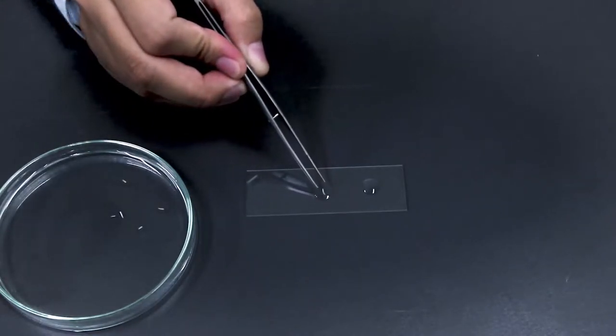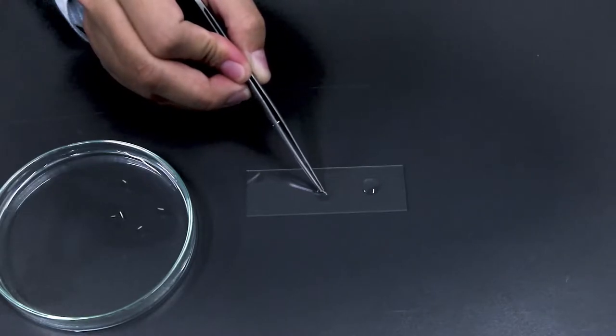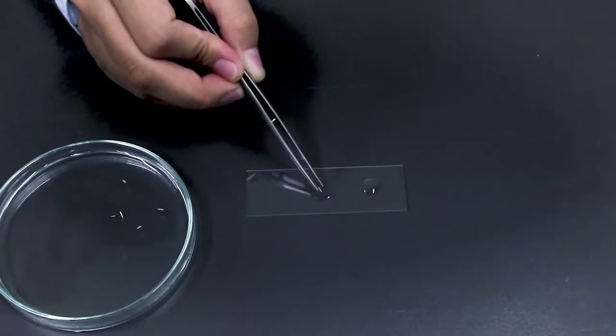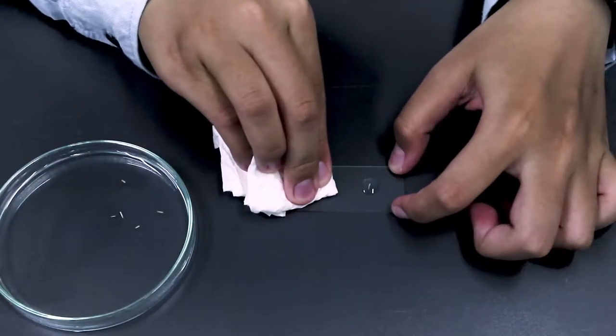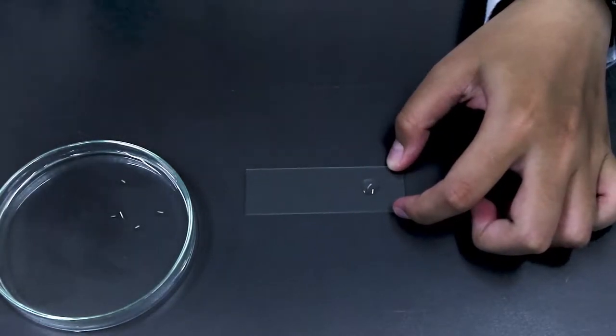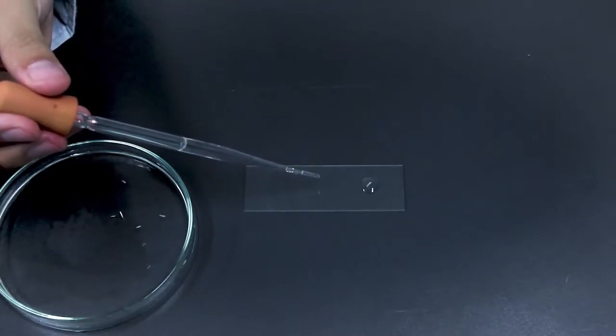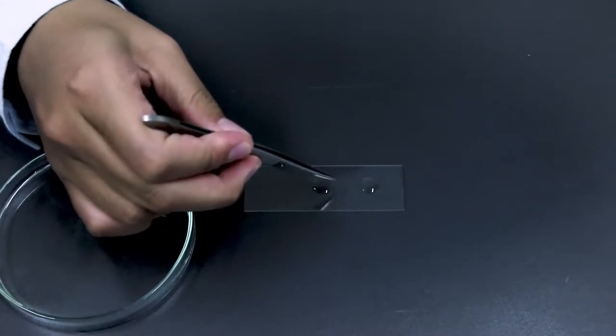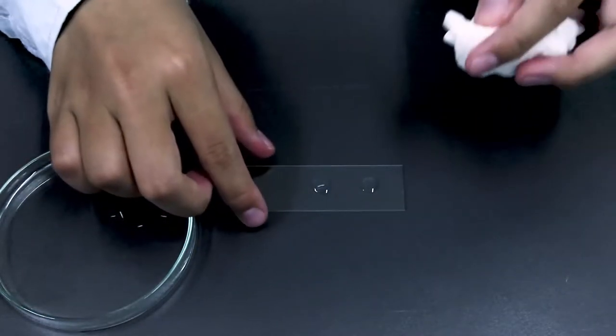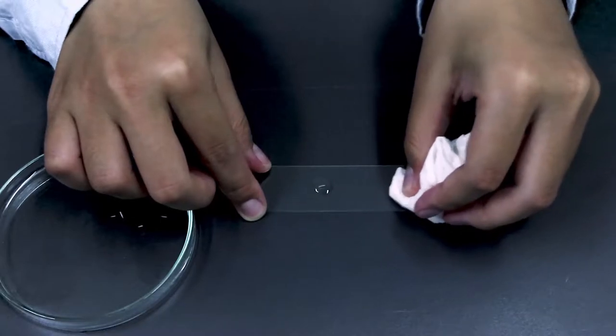After two minutes you just have to clean it with water and rinse it with water twice. Just drop one or two drops of water and then move the root tips into the clean water like this, and then get off the acid with the tissue paper. Leave it for half a minute or like 30 seconds or 45 seconds and rinse it again.